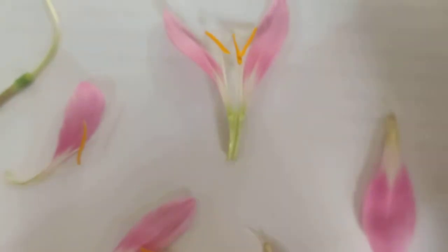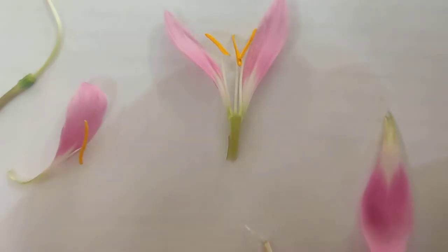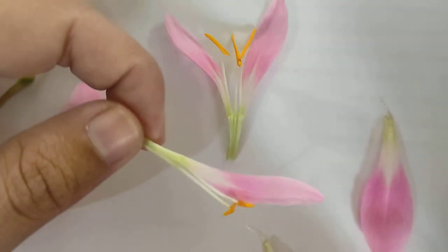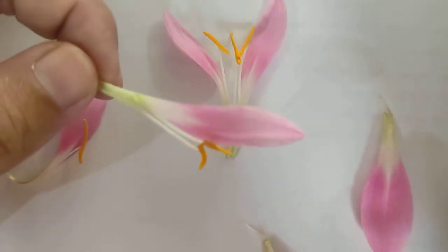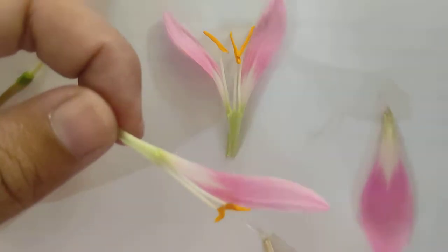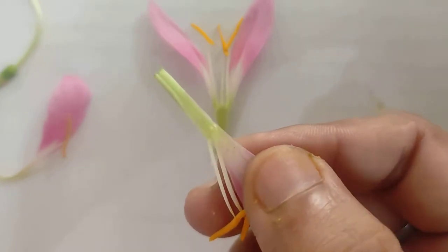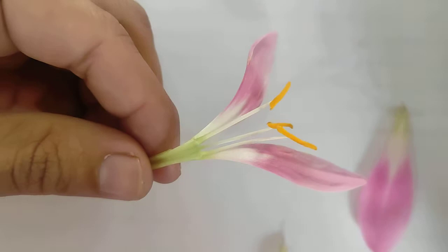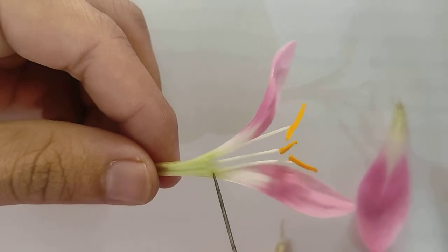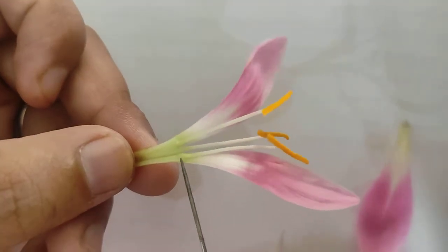As we have dissected these parts, we can easily see that the androecium — the stamens — are attached to the tepals. They are epitepalous. You can easily see they are attached here, attached to the tepals. We can also say that the androecium is actually epiphyllous because it is connected to these tepals.